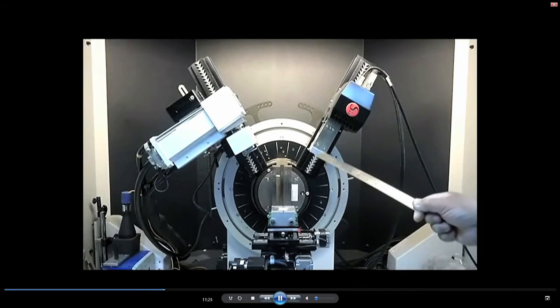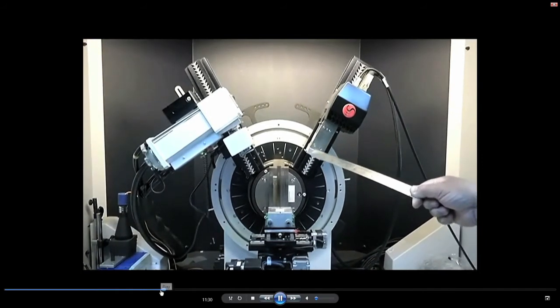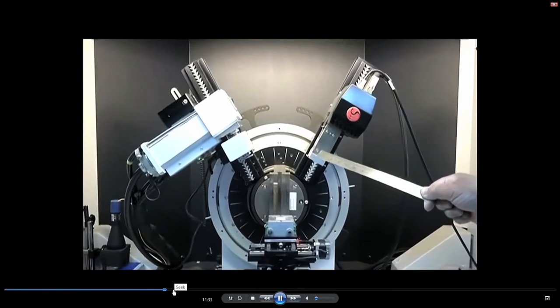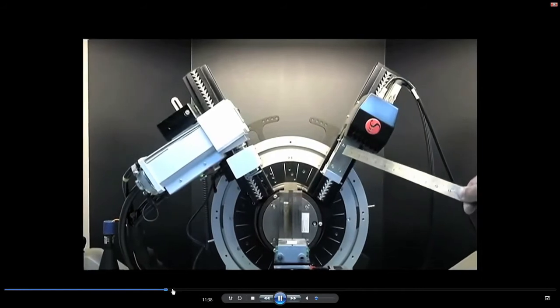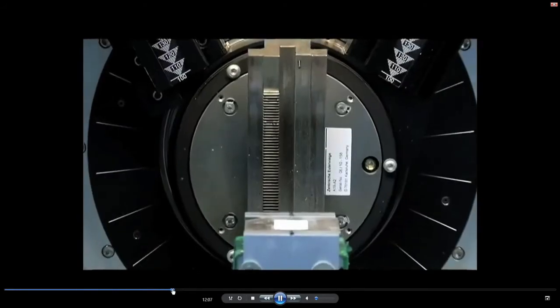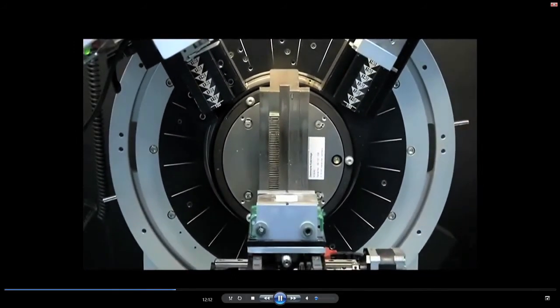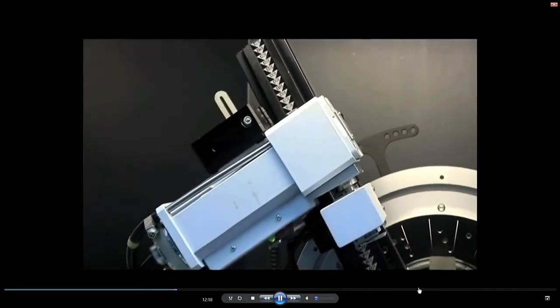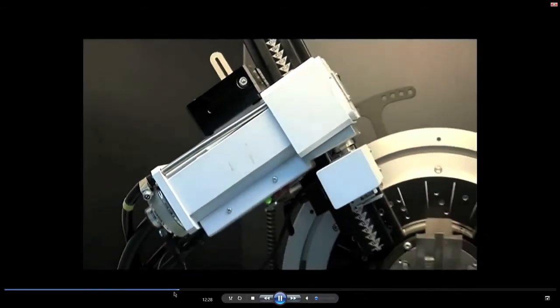Now I think that is the basic idea you should have about this X-ray diffractometer, and now we can even look at how an experiment is performed in this machine. And please remember, this stage is a rotating stage. It can rotate 360 degrees, and also it can move on a semicircle in the stage which I have mentioned.